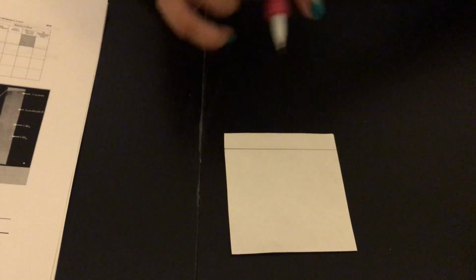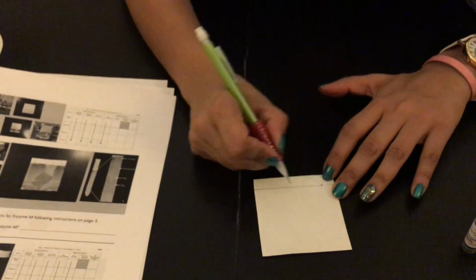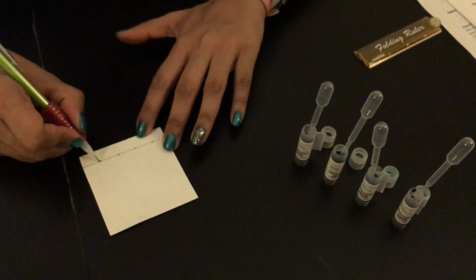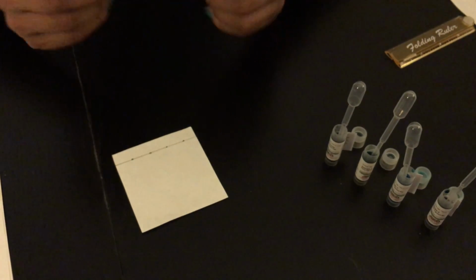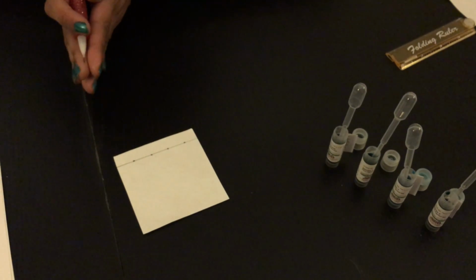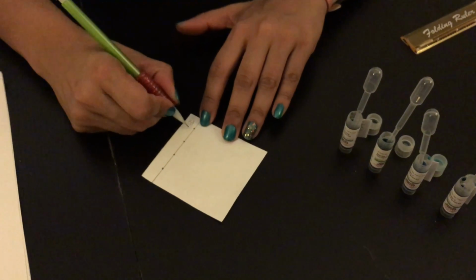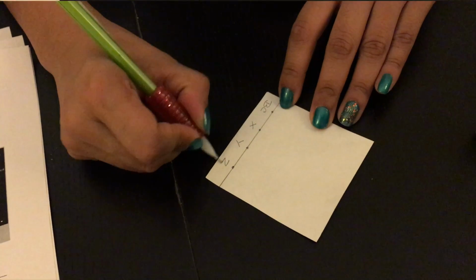In this starting line, you will mark 4 dots. So 1 will be here, 1 here. Try to make it evenly spaced as possible. And underneath the dots, you want to indicate what you're going to put in each dot. So you're going to put a pigment in each one of these dots, but you want to indicate whether it's Botanicurus. I'm going to write BC for Botanicurus. I'm going to write X for the next one, Y, and Z.